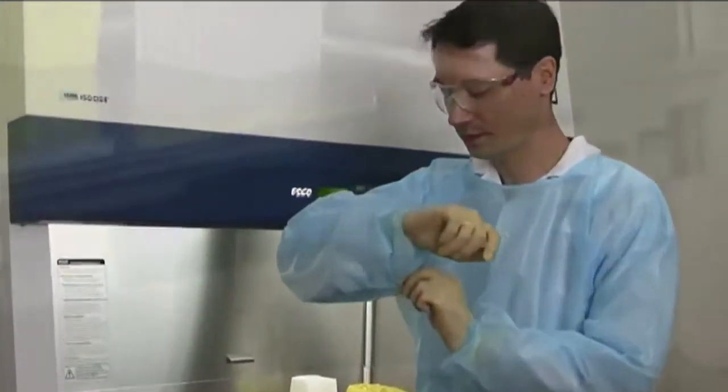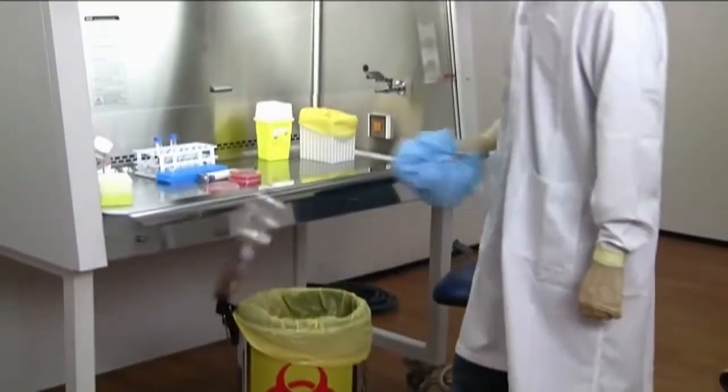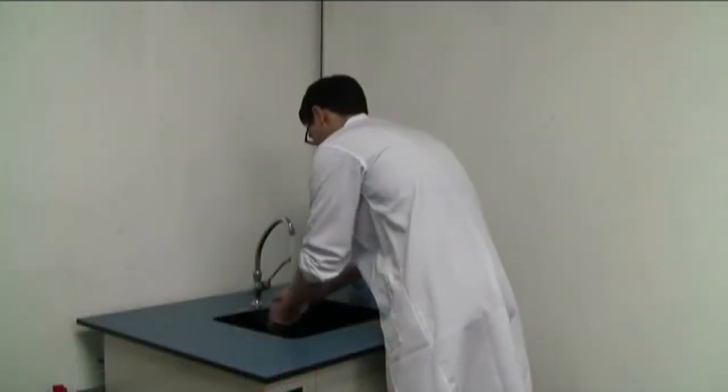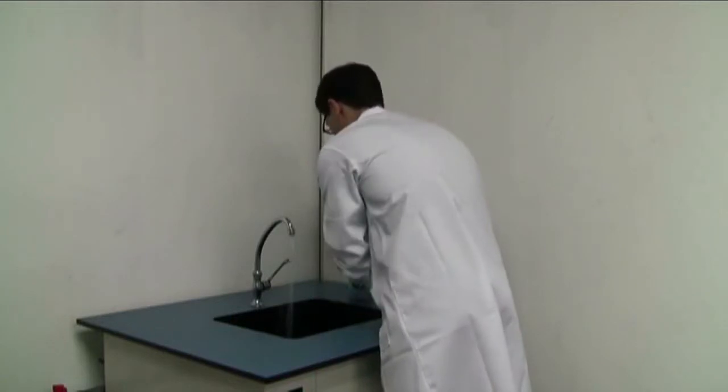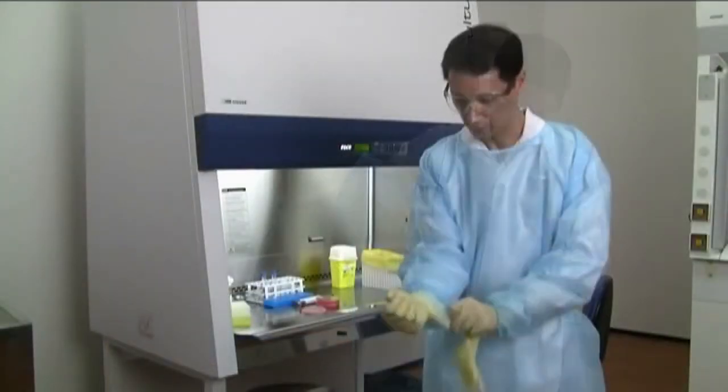Check your gown sleeves for contamination and discard the gown if it's dirty. Remove your inner gloves, wash your hands and don a new gown and double gloves.